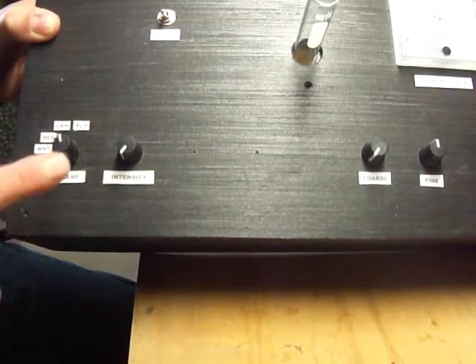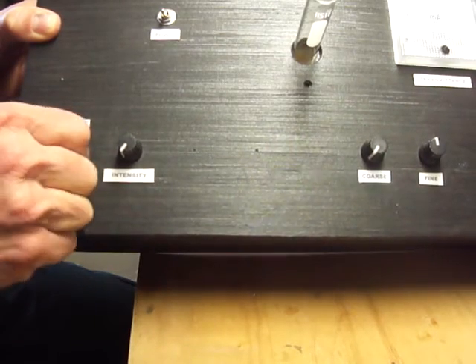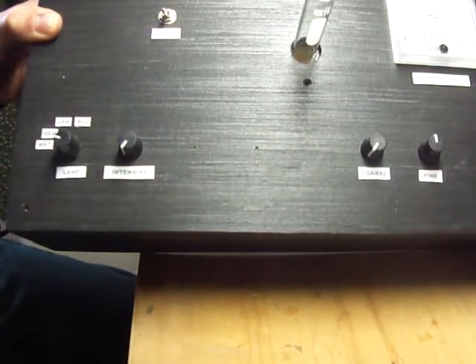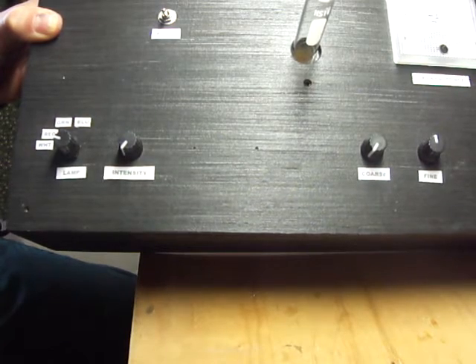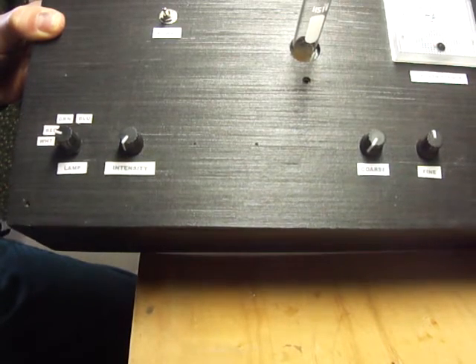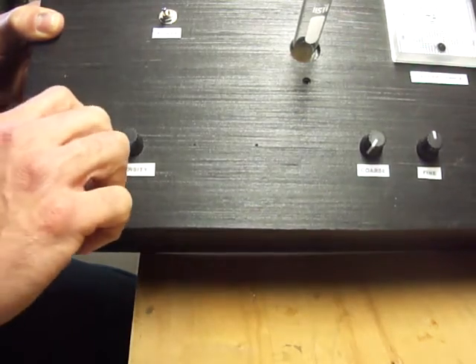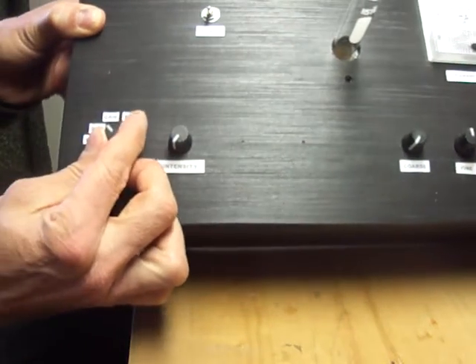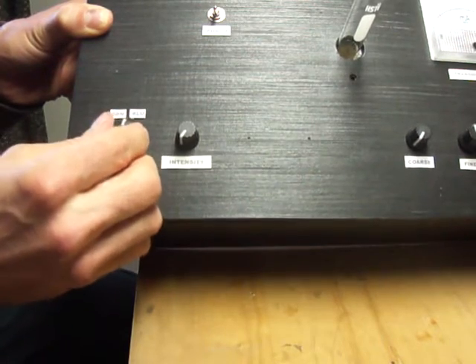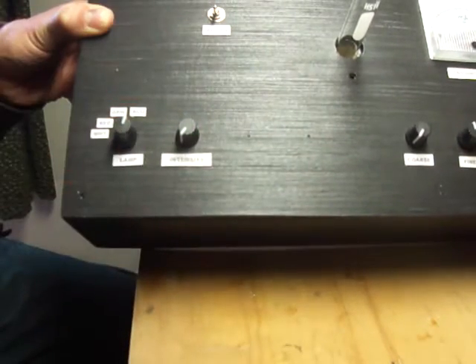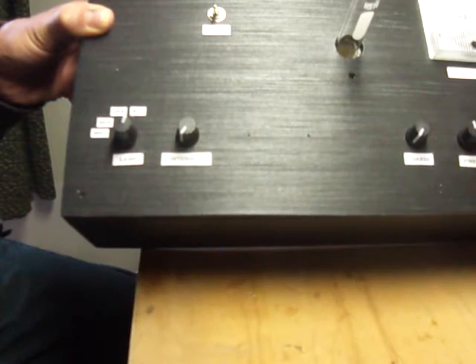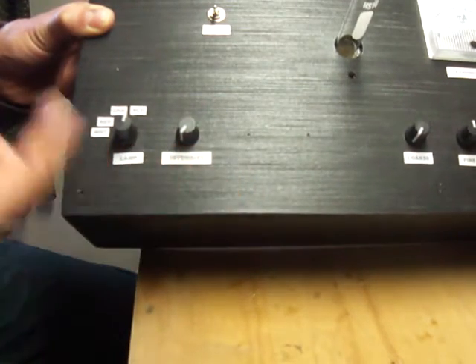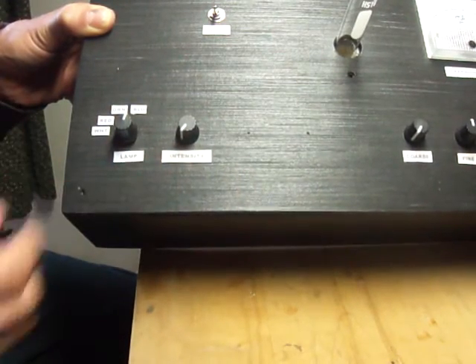The left side has to do with the light source. There's a selector switch with different options. You want to use a wavelength that is most sensitive to being absorbed for the application or solution that you're looking at. This is a six position switch and I'm using four at the moment.